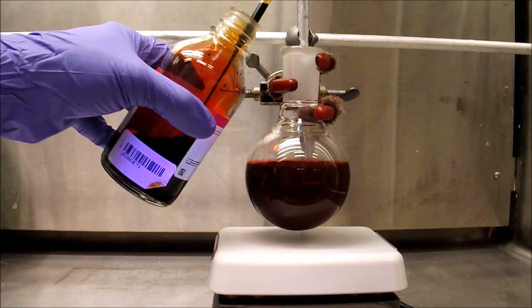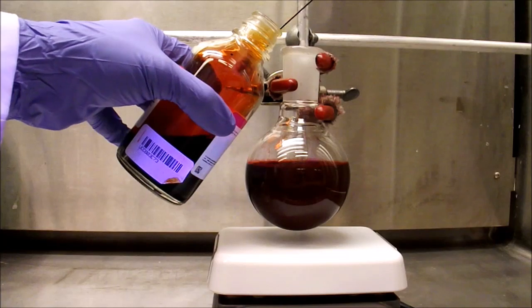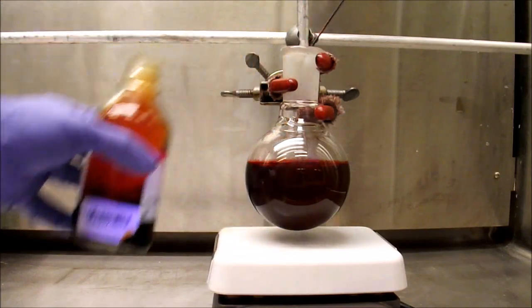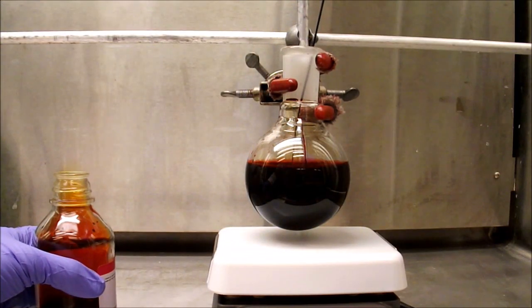If you watch carefully, you can see that the solution darkens dramatically as the bromine is added. This is due to the bromine quenching the fluorescence from the PDI.